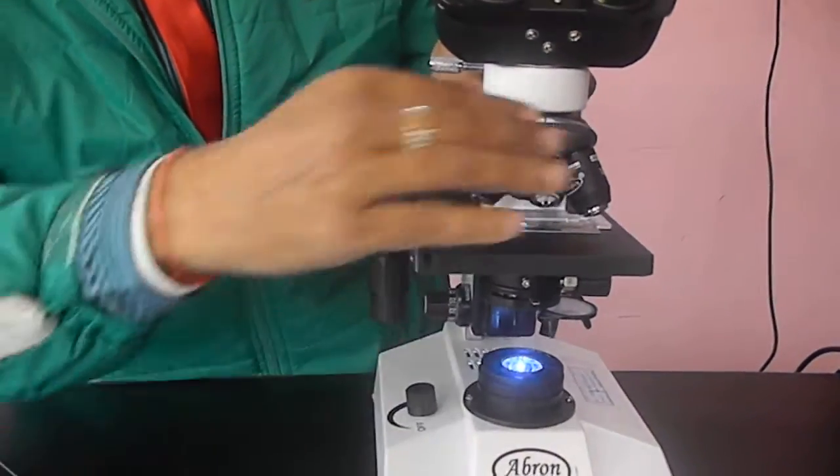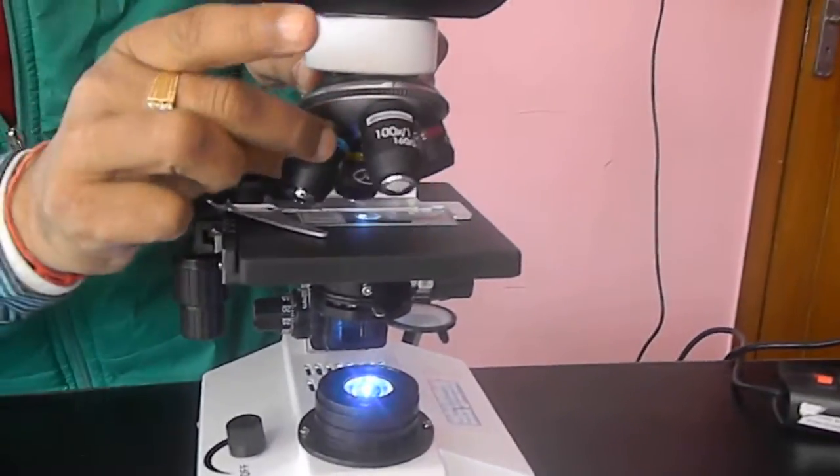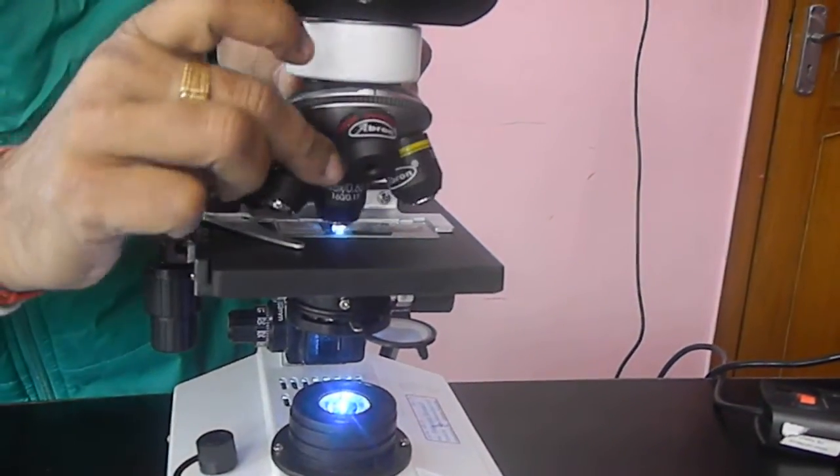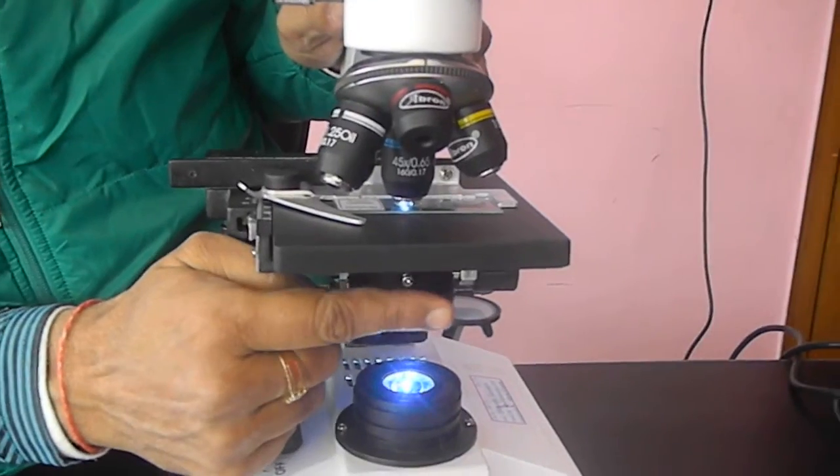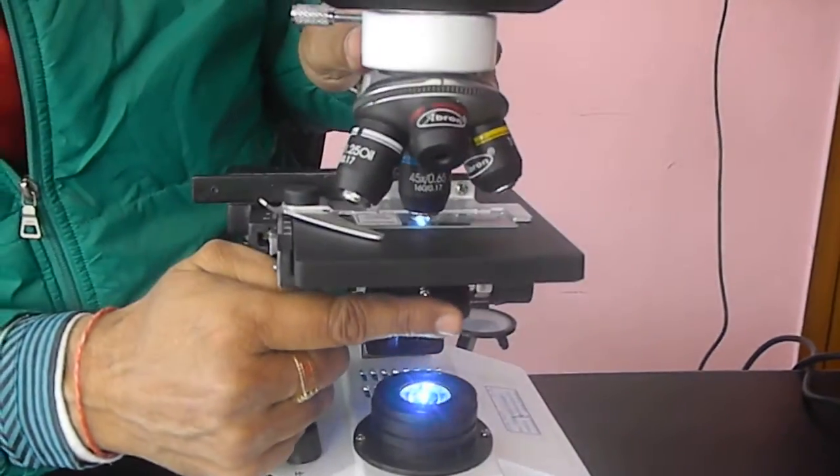Similarly, when you put it on the 10x or 45x, use the same system. And adjust this iris so that the sharpness is there, maximum sharpness is there in the subject.